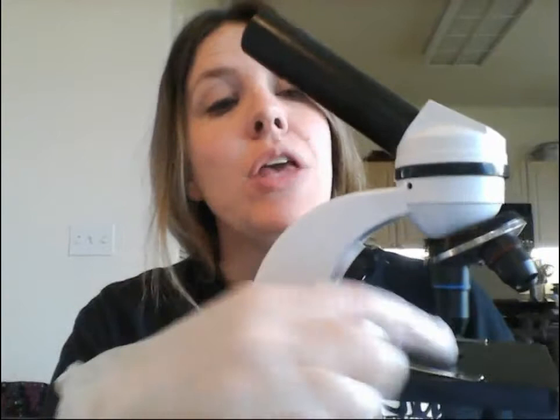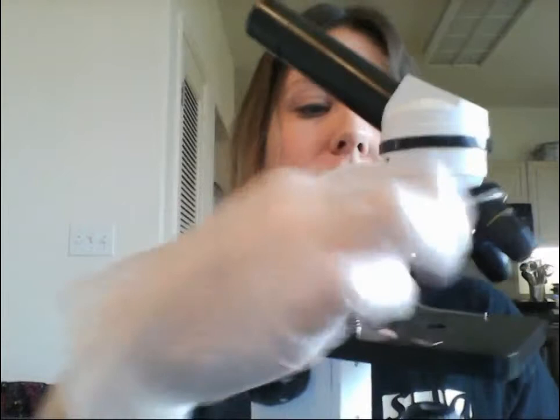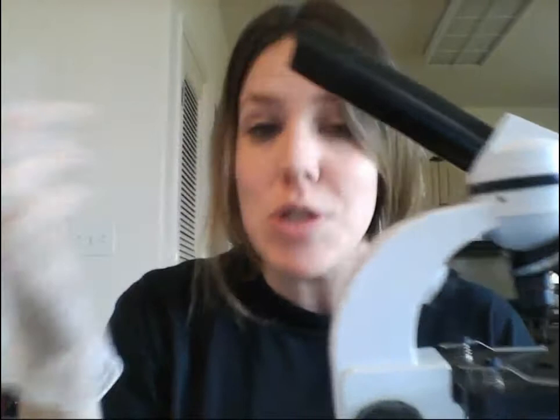Those are just the magnifications of the objective lenses by themselves. However, when you look through the ocular lens, you get a total magnification — that total magnification is 10 times whatever the objective is. So we always start on the lowest magnification, 4x. The ocular is 10x, so total magnification is 40x. You always want to be specific: are you talking about just the objective lens magnification or the total magnification?